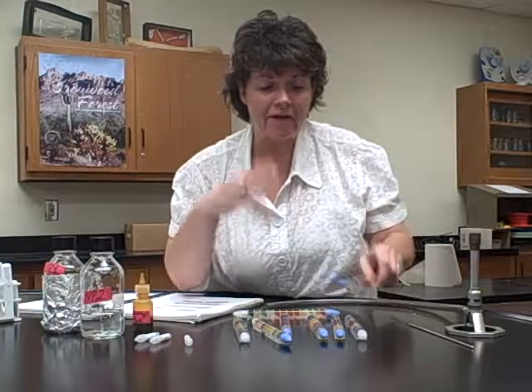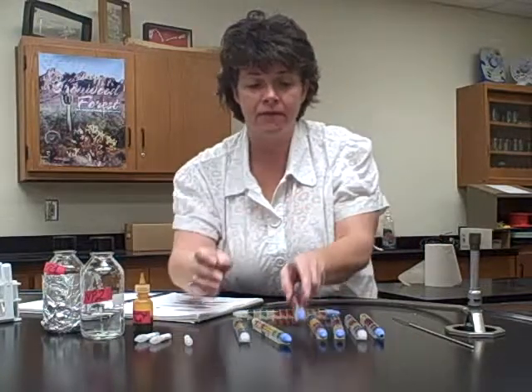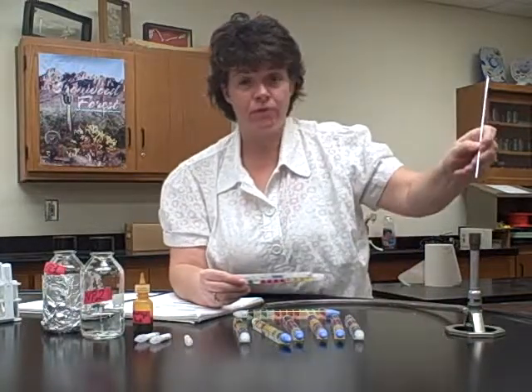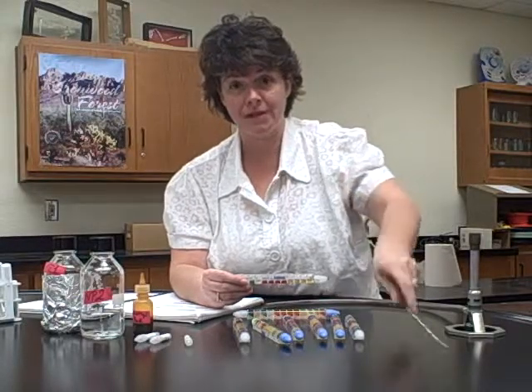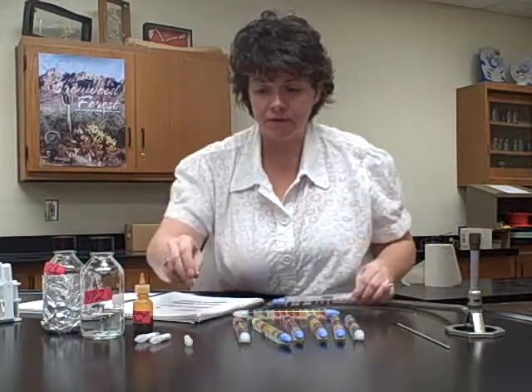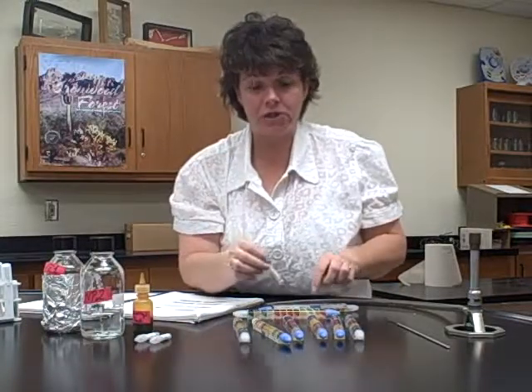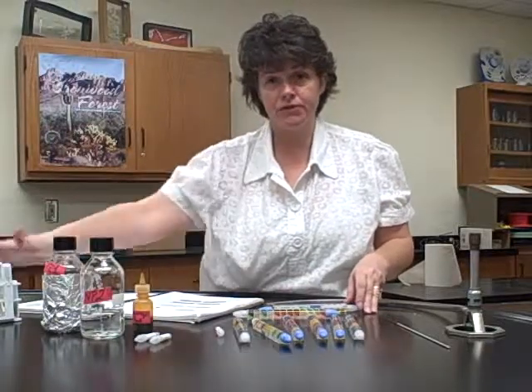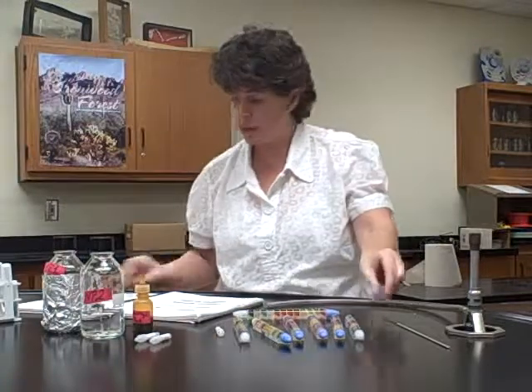So for that, after you've read the hydrogen sulfide result and whether or not you see the black, you're going to turn it upside down, flame your loop, and literally burn a hole through the plastic. After you burn the hole through the plastic, you're going to add that same indole reagent to that compartment. You can see some of the results are overlapping, but this gives many different results.